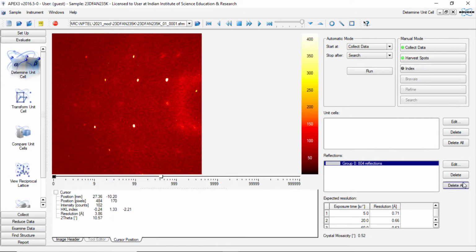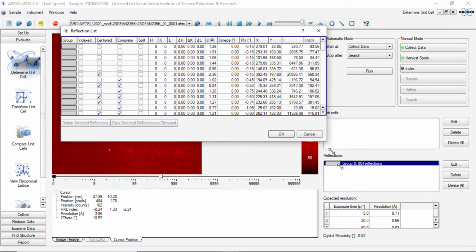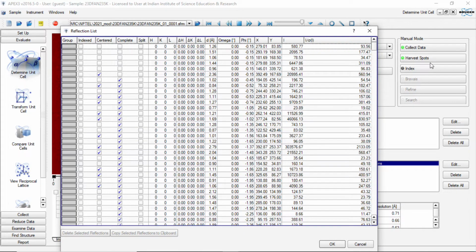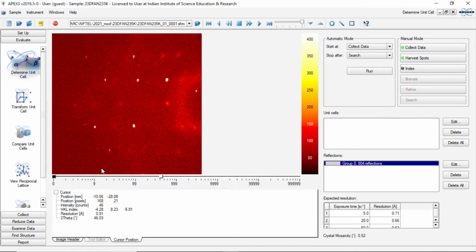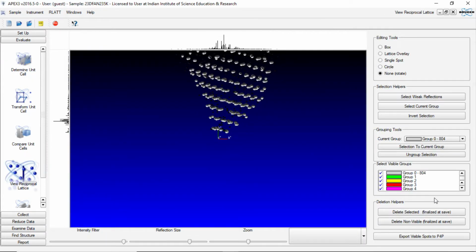To view these reflections, one can go and click on edit. You will see all the parameters related to these reflections as a list, which are essentially meaningless at this moment, because these are numbers where the reflections were found, the values of omega, theta, phi and chi and so on. From this we have to get the unit cell parameters. So we want to see these reflections in the reciprocal lattice viewer, which is here on the left hand side of the screen. If you click on that, it will open the reciprocal lattice viewer and show all those reflections, which are shown in gray.